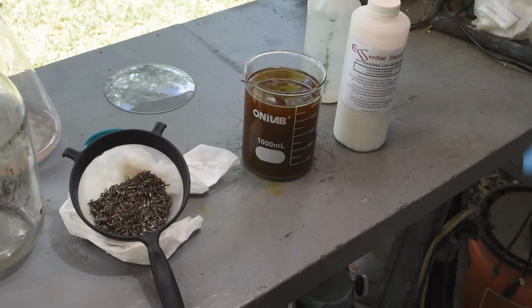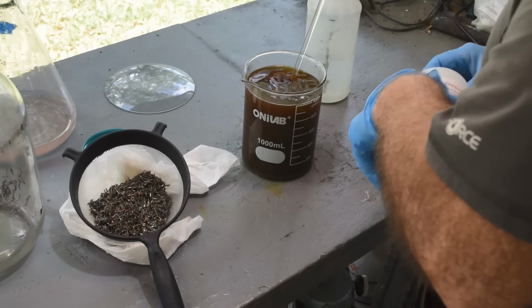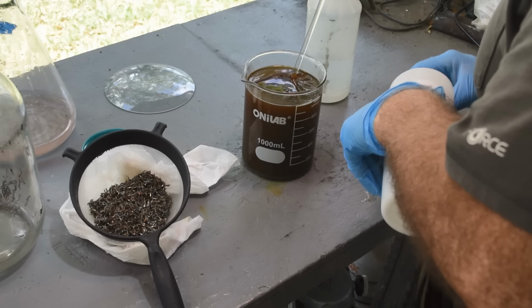And this should not take too much potassium hydroxide. Anthony Thomas, if you're watching, this should not take too much potassium hydroxide. If you use a mild acid like formic acid to adjust your pH down, you're not going to need too much potassium hydroxide to adjust your pH back up again.